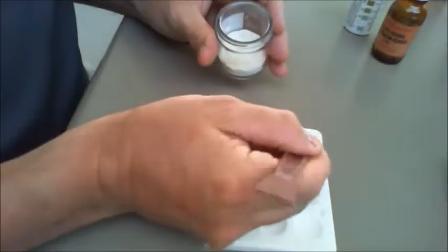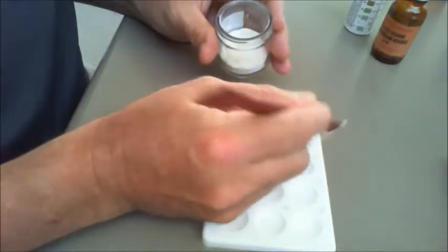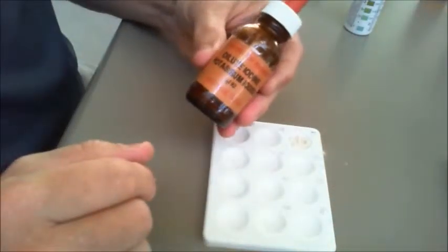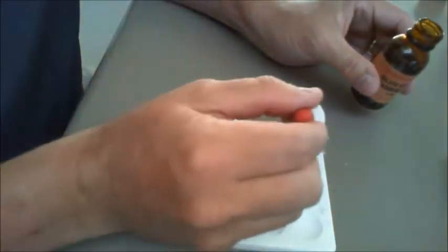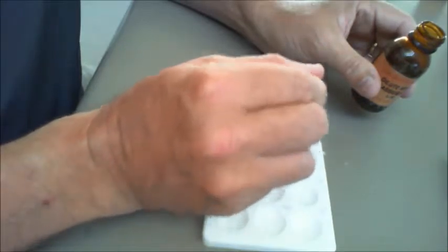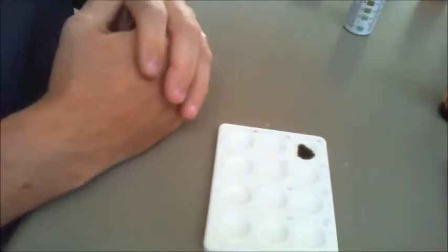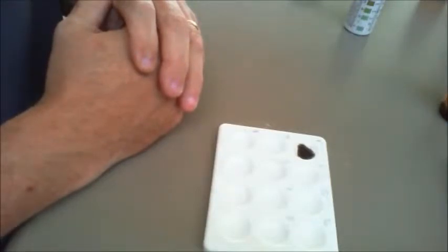So what I've got here is, we'll have a look at the test for starch. So just put a little bit of food material in here. All of these have a mixture of various different things. To do that, we start off and we use dilute iodine, or potassium iodide as we call it. Now that is a yellow colour to begin with, as you can see there, and then when we add it in, if it goes a blue-black colour like it has there, then that's the test for starch. So whether it goes blue and black.